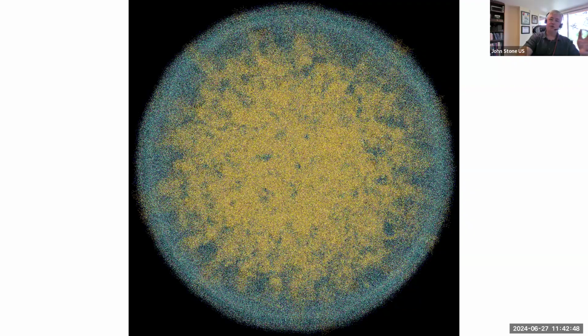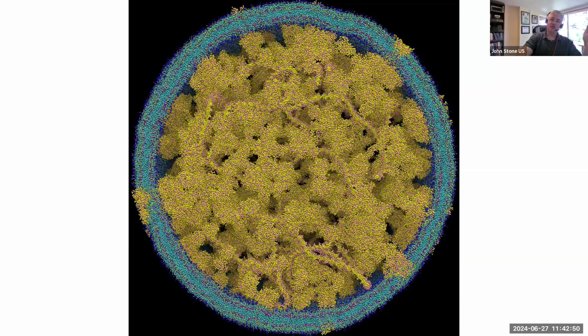If we just do a few simple selections to remove solvent, which granted, I had to figure out what the names of the particles were for the solvent, already we go from a fuzzy mess to where I can actually see DNA and some of the constituent structure on the inside.